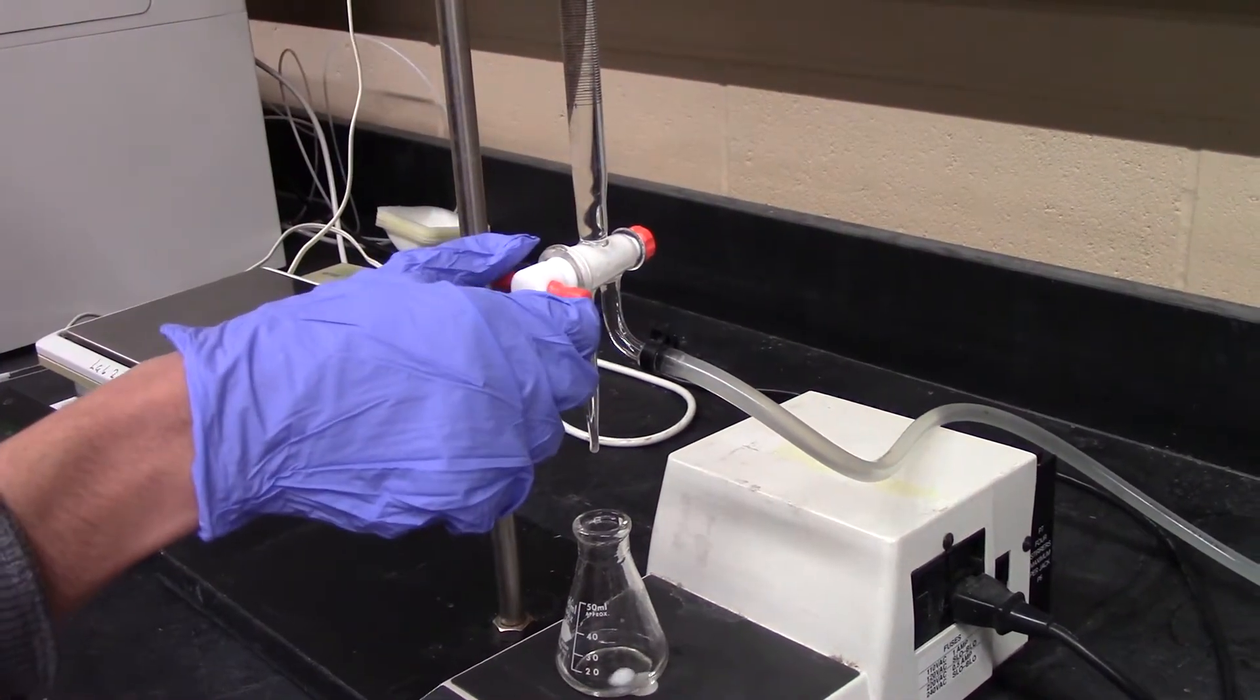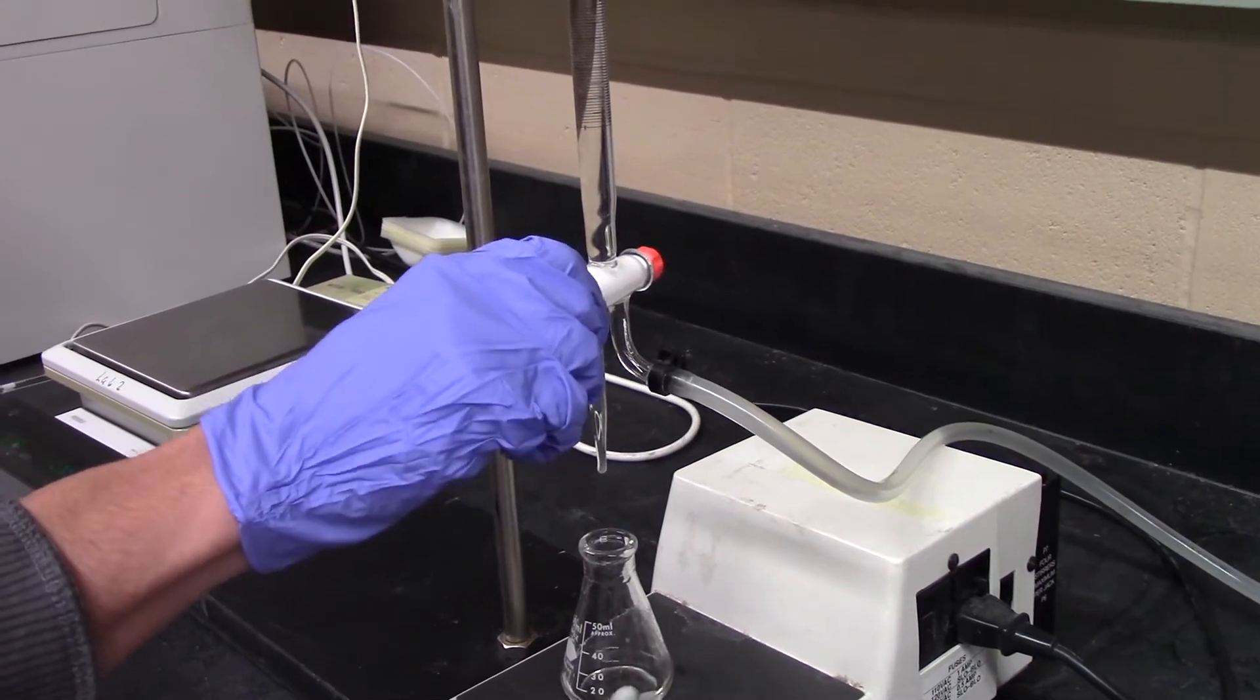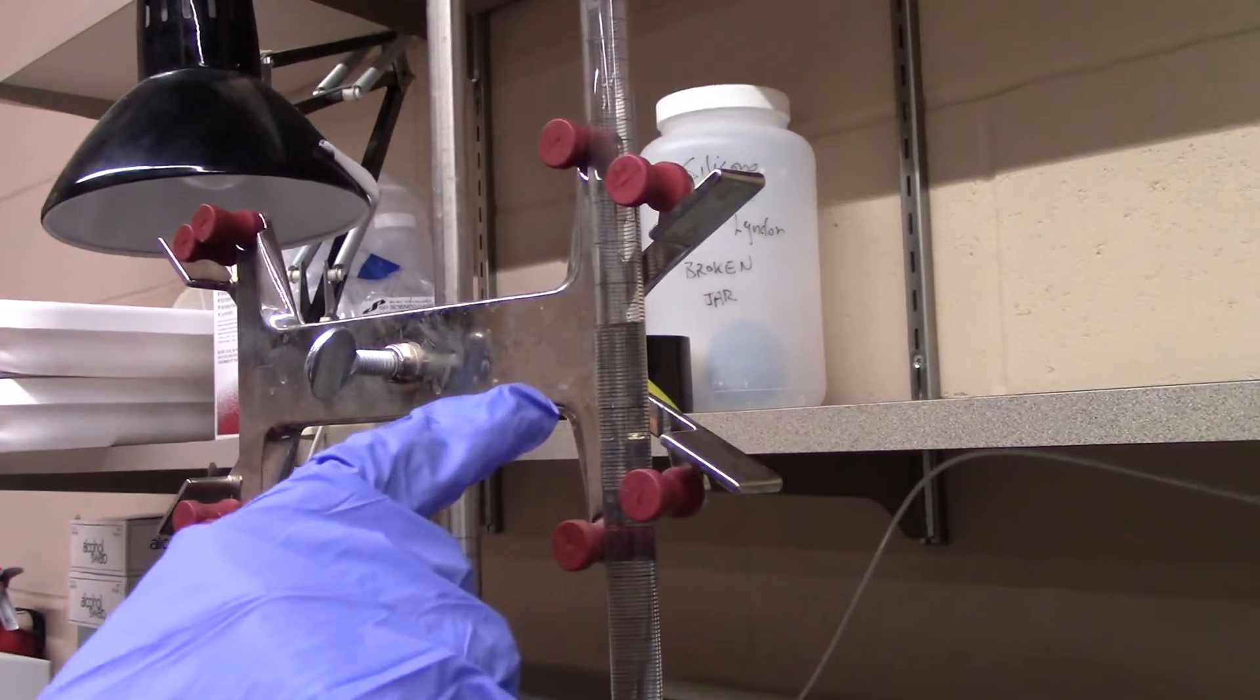In order to fill up your burette, you'll want to turn the valve to the left, and as you can see, due to gravity, the NaOH levels are rising.